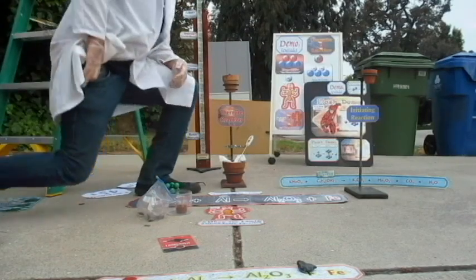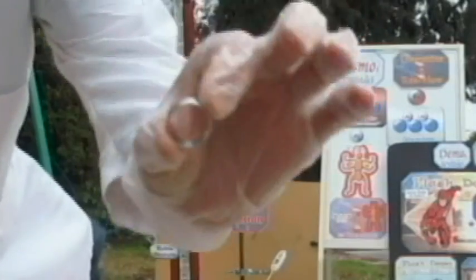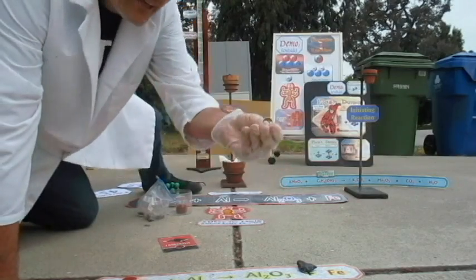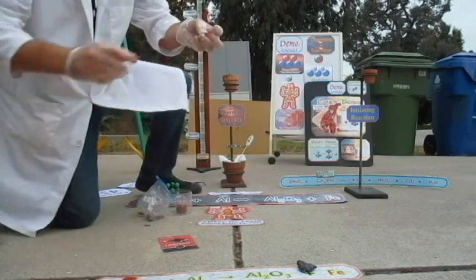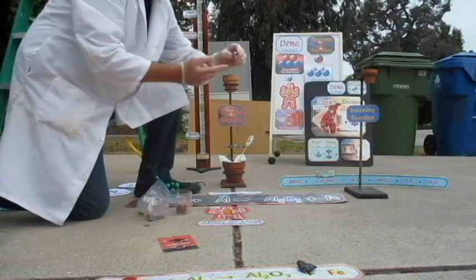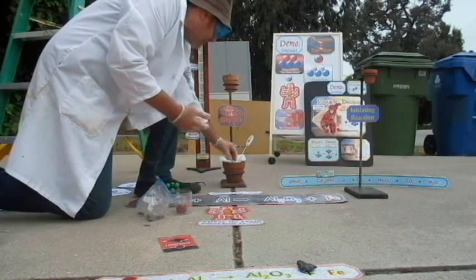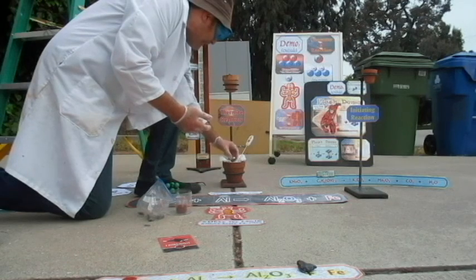Because, remember, one ring to rule them all, one ring to bind them, one ring to bring them all, and in the dark, I think I misquoted that. Anyway, Lord of the Rings. So in honor of Lord of the Rings, I'm going to put a little piece of platinum in here. This will probably be okay. We'll see if it melts the platinum. I'm going to put it next to the ionic compound.